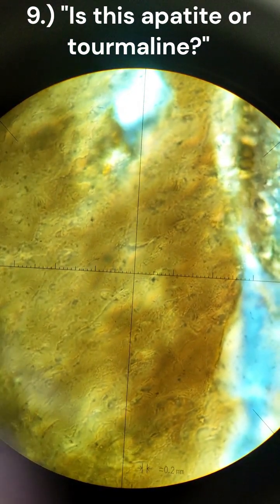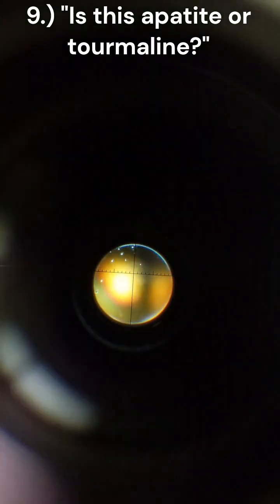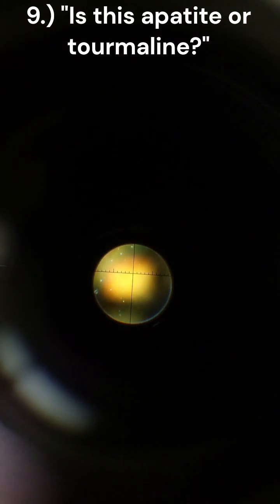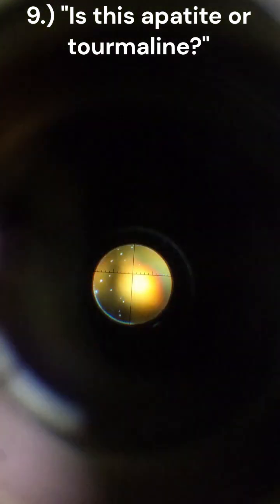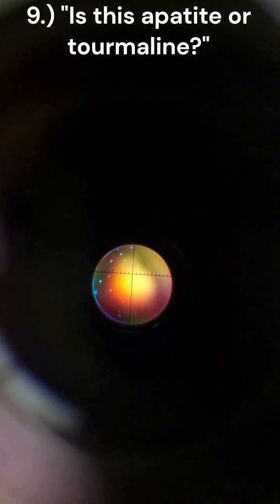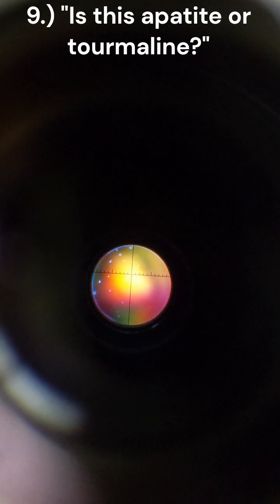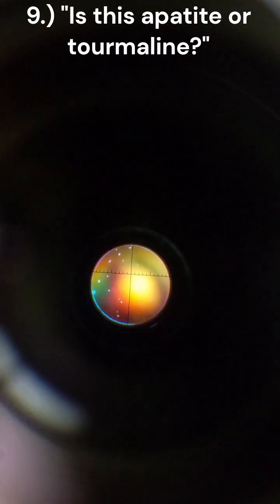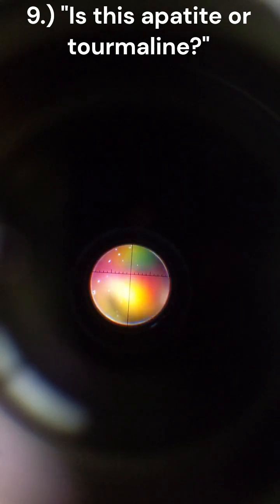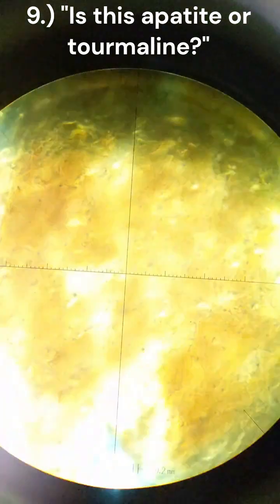And going to Bertrand lens, you can see we do have a uniaxial mineral, whatever this is. And putting gypsum in, really close, you can see bottom right has blue, top right has orange, top left has blue, so it's uniaxial negative. For sure not quartz.